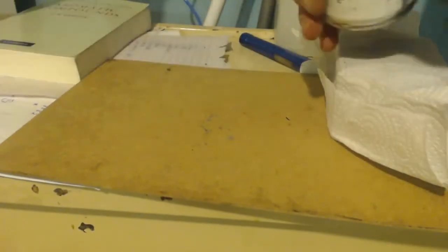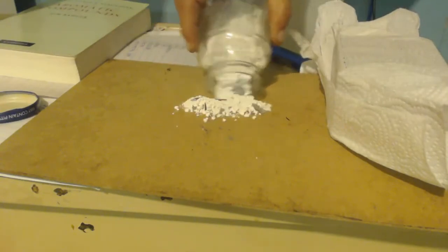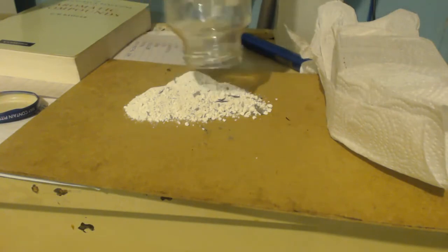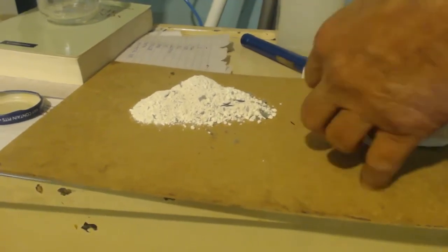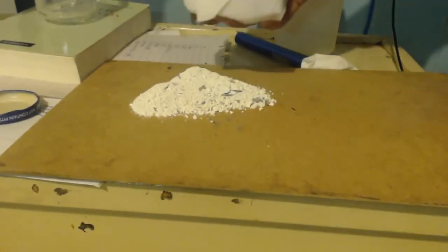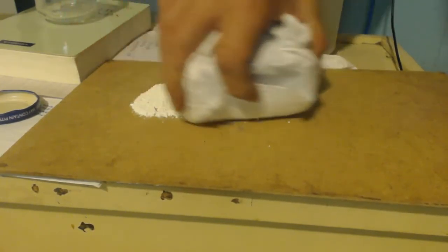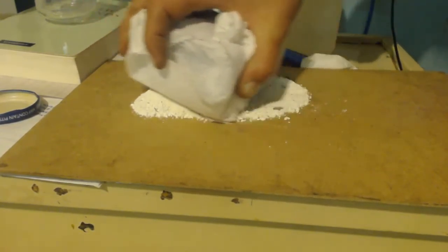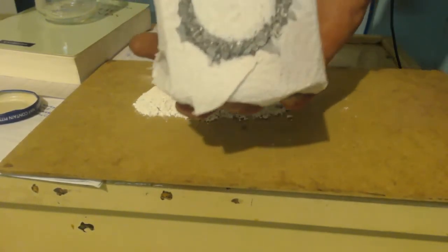Alright, I wrapped my magnet up in a paper towel. I should have put so much maybe, so it doesn't all stick to the magnet. Oh shit, yeah, it's getting it out of there. Oh hell yeah. Or, I shouldn't swear. Alright, well you can see how I'm going to clean it out of there. Look at all that metal there.